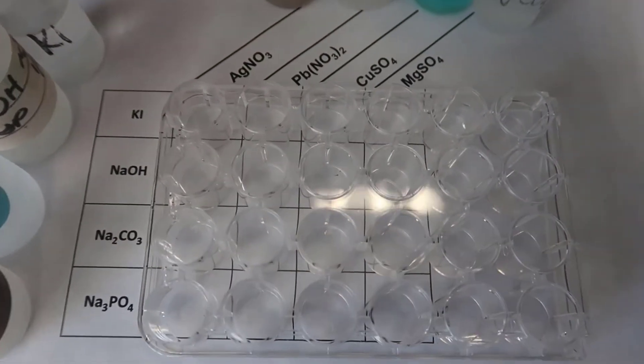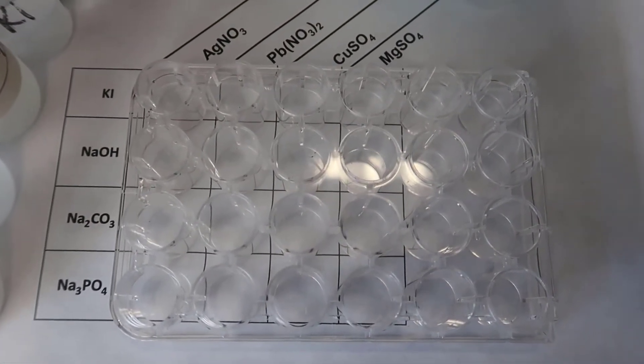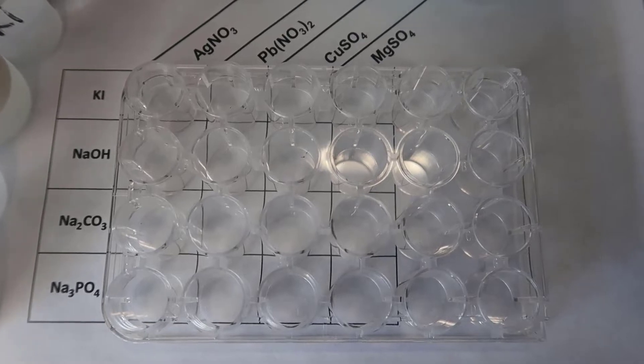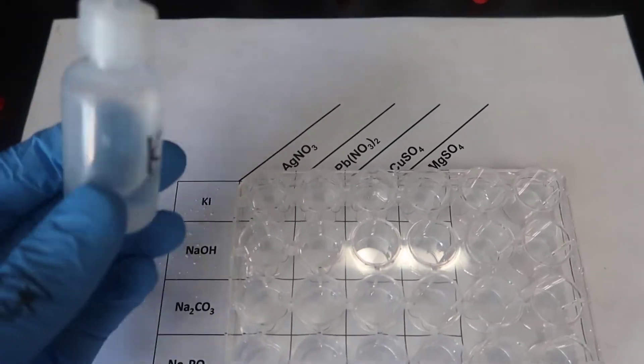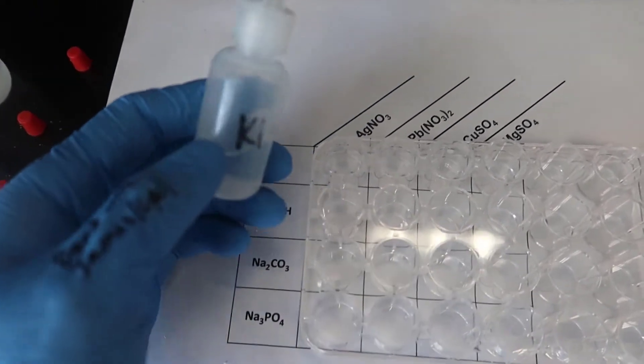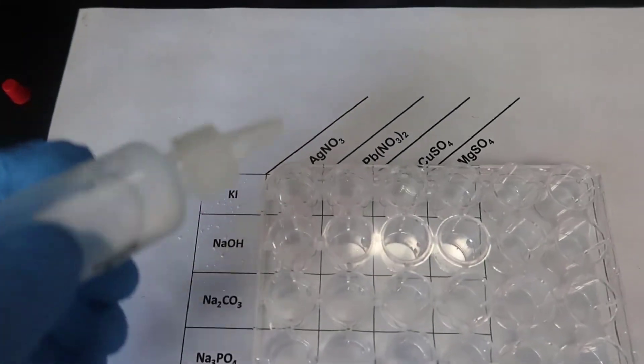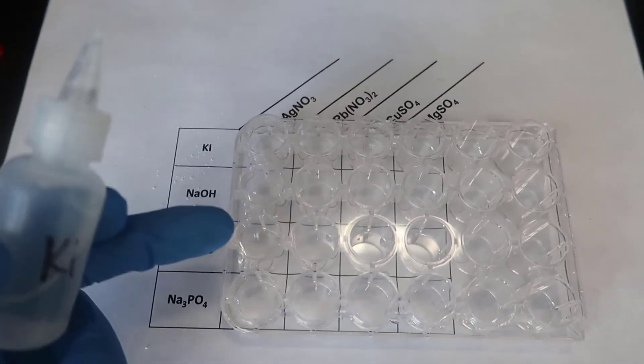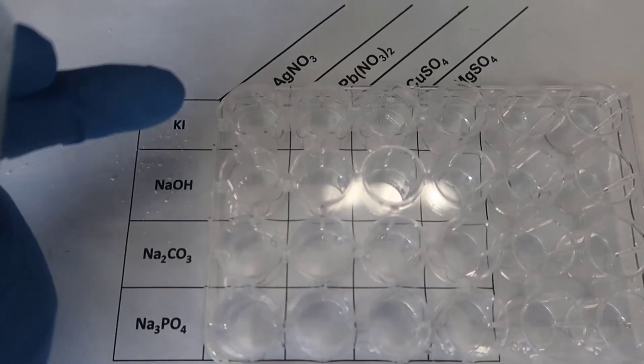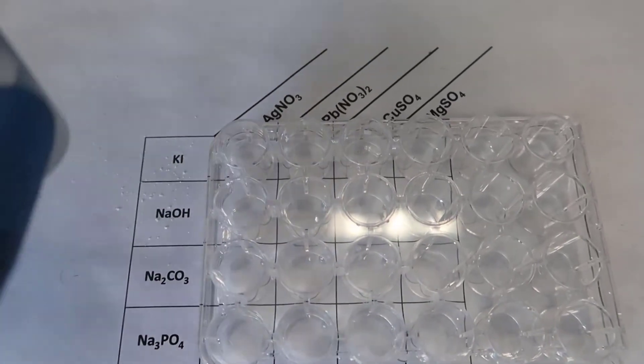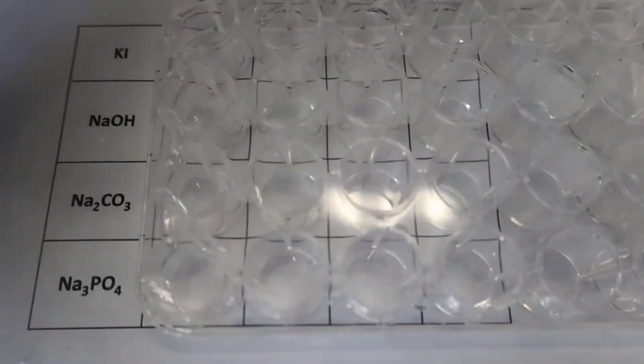And then what you will do is you will pause the video if needed and record your observations. So earlier I said two drops, I am actually going to go ahead and do about 10 to 15 drops of each solution, only because normally when my students do this, they do it in a shallow well plate, and this one has deeper wells, and so just for you to be able to see, I am going to add about 10 to 15 drops of each solution.